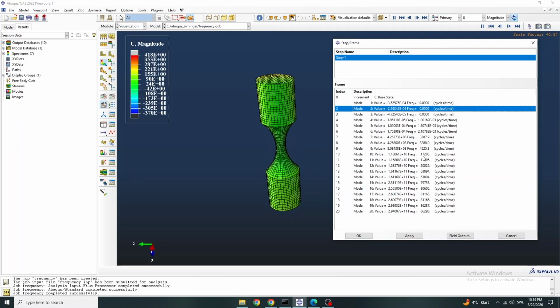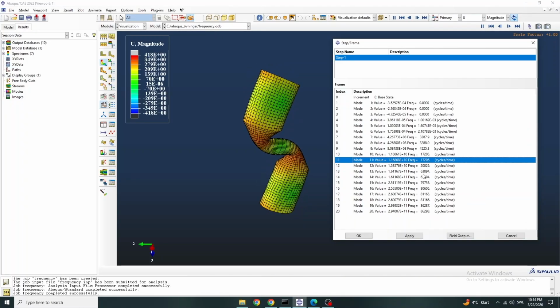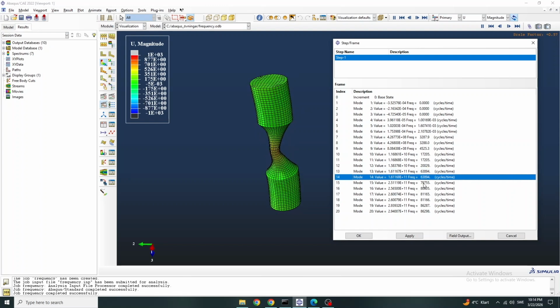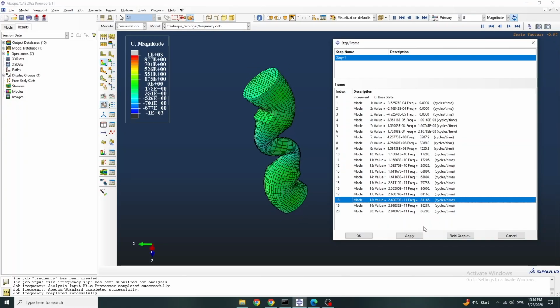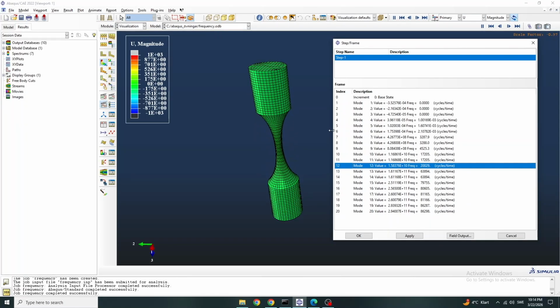We are looking for 20 kHz, so it's this one that we are looking for, tension compression. But you can see the other frequency modes, mode shapes and eigenfrequencies. This is the interesting one. But you can see the 21 frequencies.